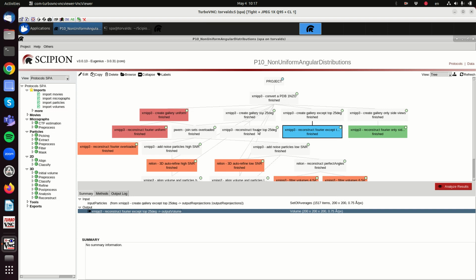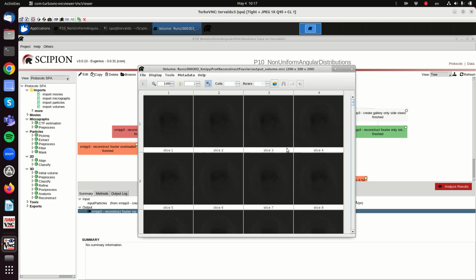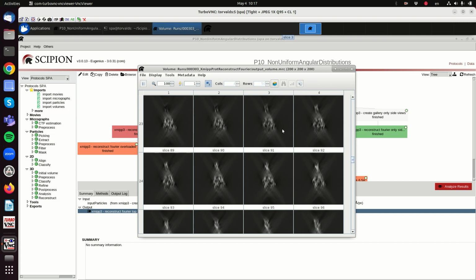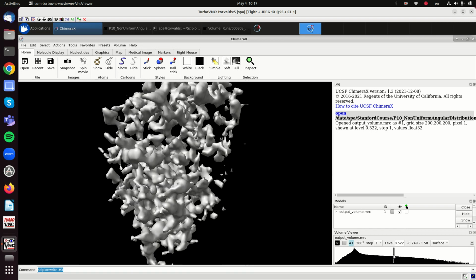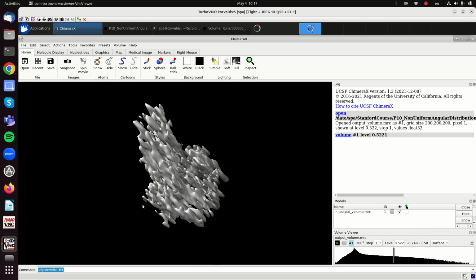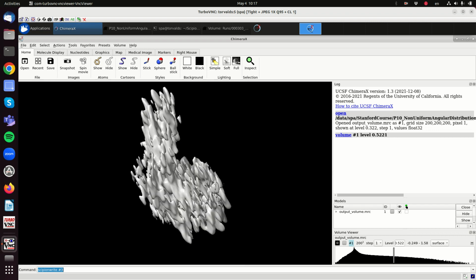What happens here? If we only have top views, from 0 to 25 degrees, now we look at the structure from the top view, and we start to see some kind of artifact around. Can you see? Here we have a kind of halo around, and some of the slices are very good. The central slices are very good because we have a lot of top views. But when you look from the side, you start to see problems, because we are filling only a part of the Fourier space. Missing information results in this elongation. Okay, so that's good. We understand that now.